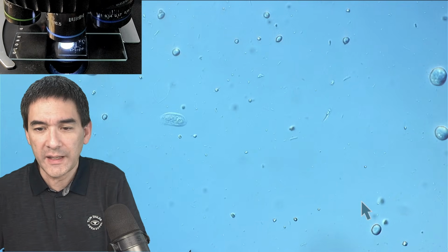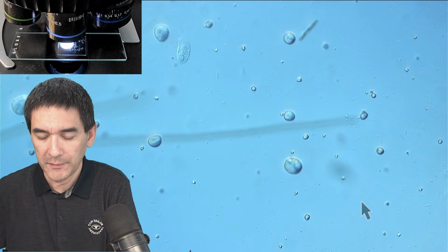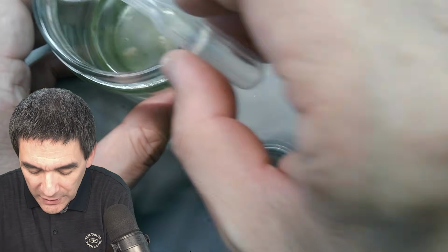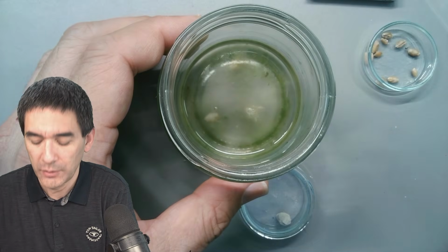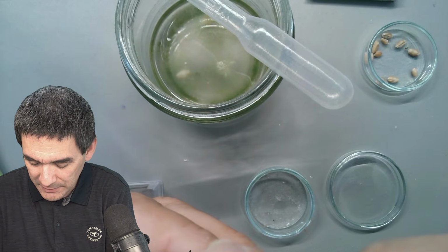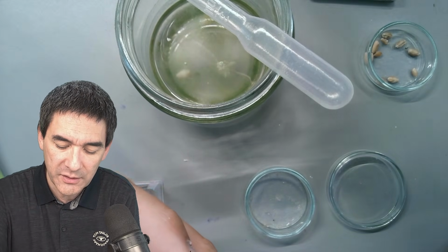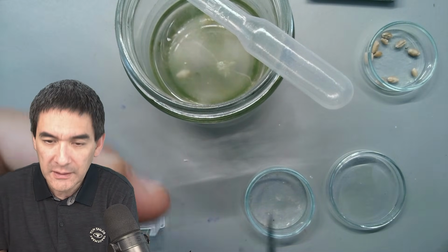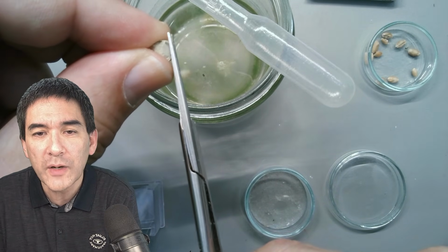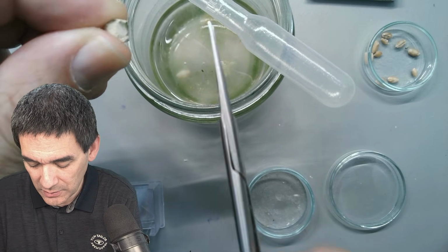Let's try that. I don't know if this actually works well or not, but I'm going to switch back to the desk view. I'm going to start feeding this water sample. Of course, you see it's a little bit greenish, right? From the algae that were present. But if you want to feed them, what I've got here is a small tablet of chlorella algae. They sell this stuff as a food supplement, but what you can also do is take scissors and take a small amount and scratch it off in here. And then sometimes this also works quite well.